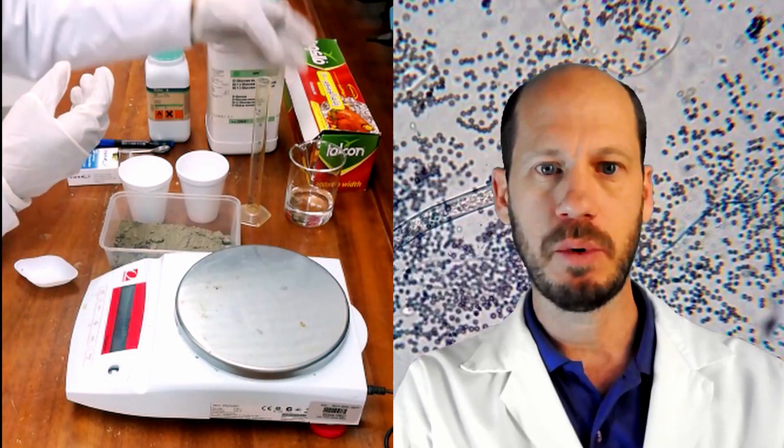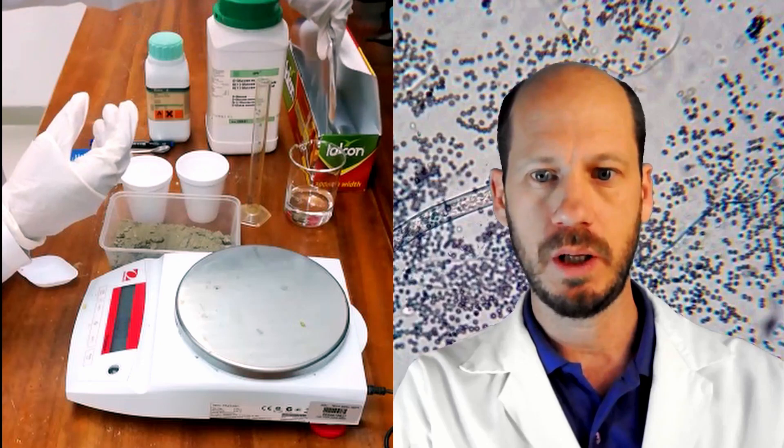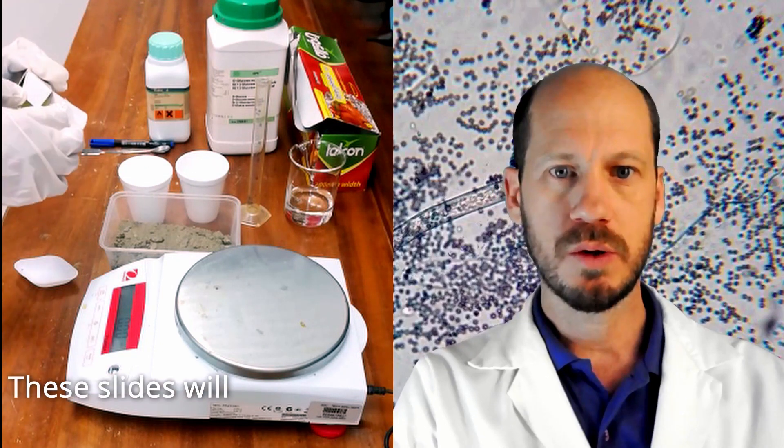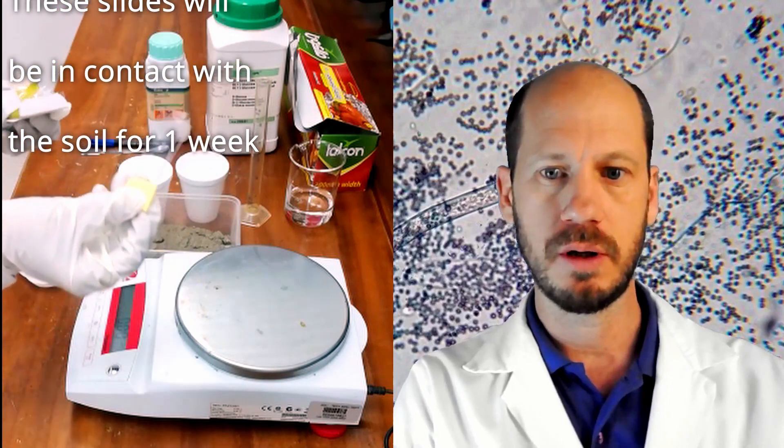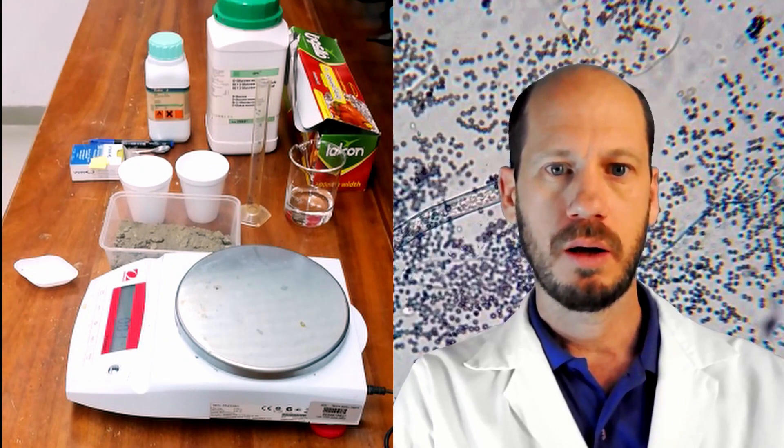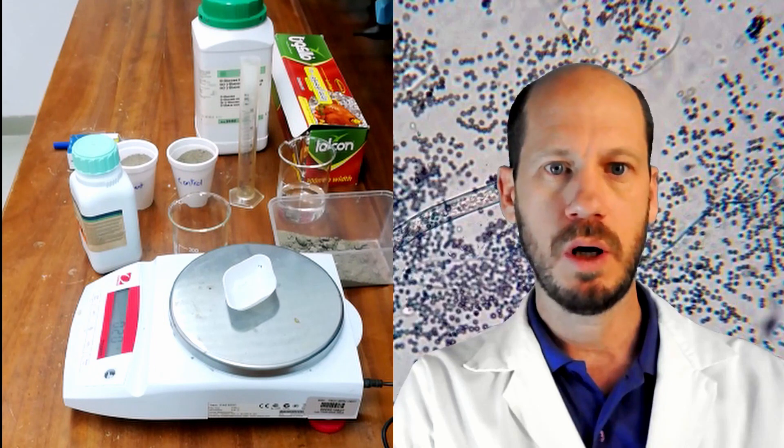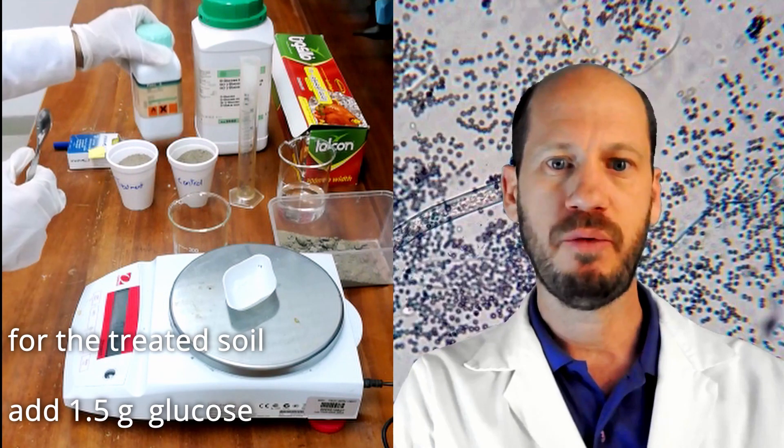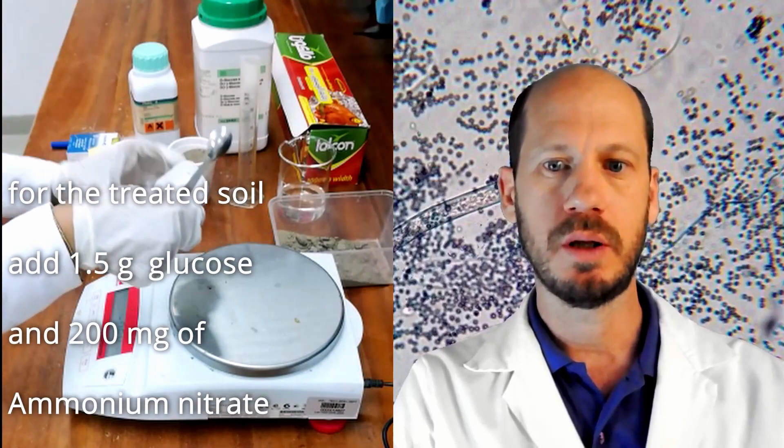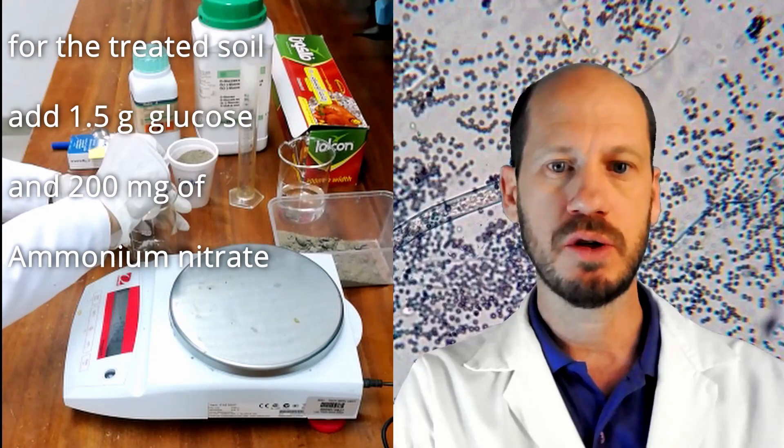Here you can see the slides that we will bury in the soil for one week, considering that one soil will be treated and the other one will not. In one soil we will observe just normal growth of microbes in the soil with water. And in the other soil we will observe what will happen if we stimulate those microbes with an easy source of nitrogen and carbon.